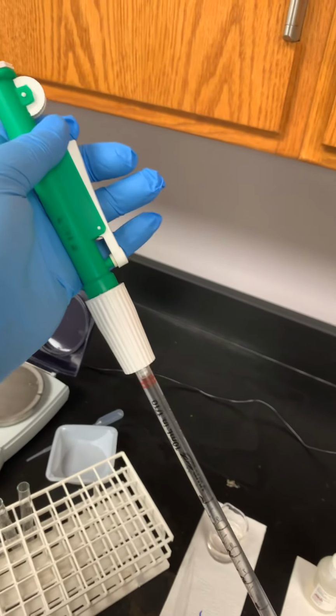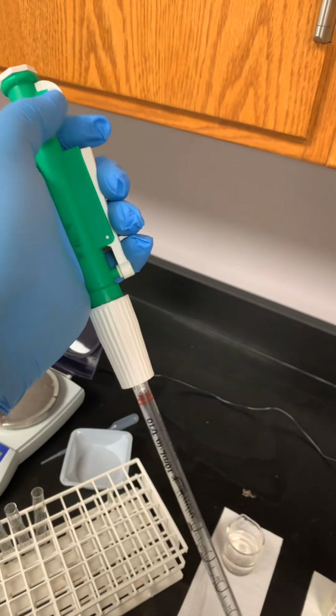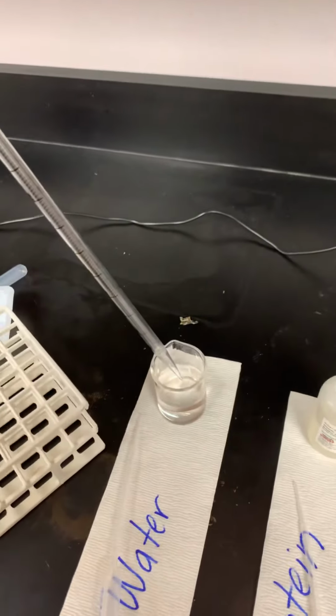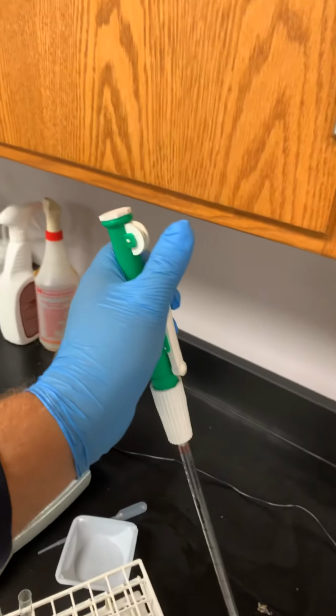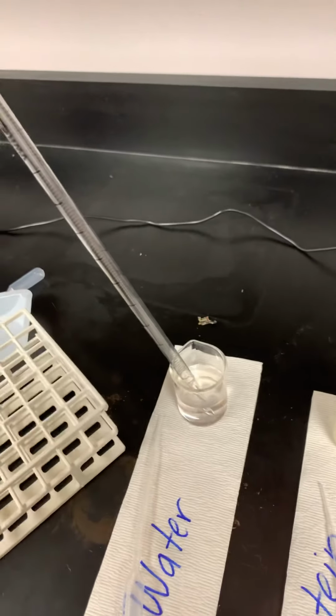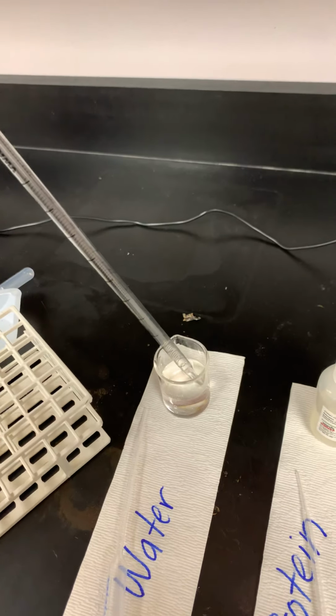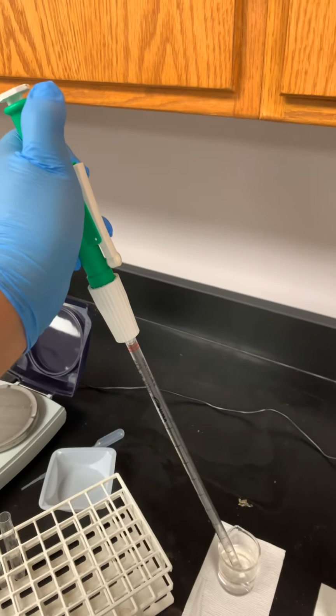So, as I said, I need to have this ready. Make sure the pipette's firmly seated into the pipette pump. Make sure it's set to 0, all the air's expelled out. The tip is going to go down below the water before I even do anything. So you've got to get that down below the liquid. It doesn't have to be all the way down to the bottom, but you want to be somewhere close to the bottom. And then I'm just going to start rolling this up.